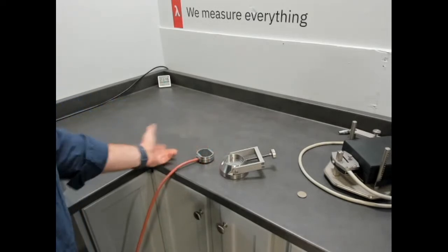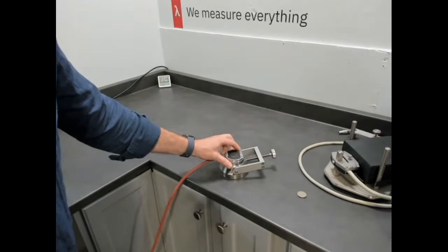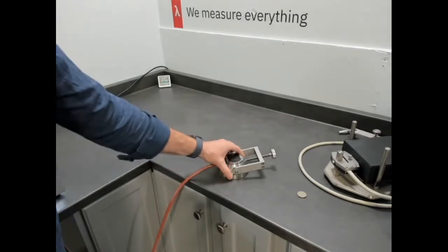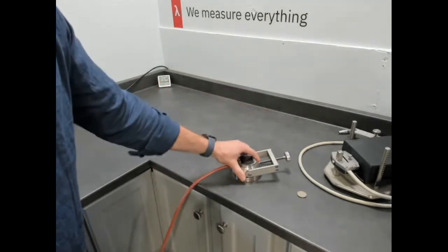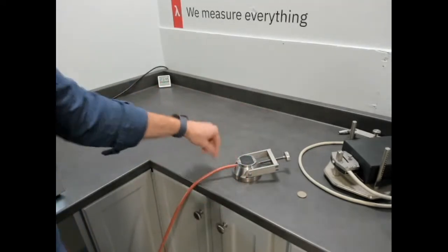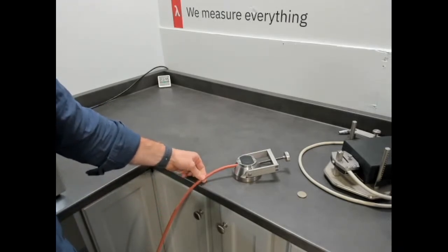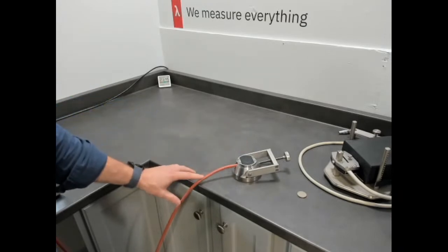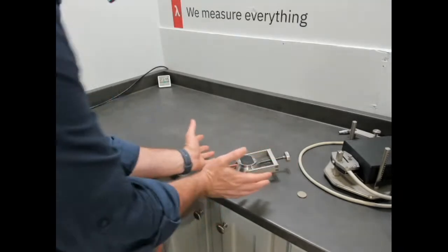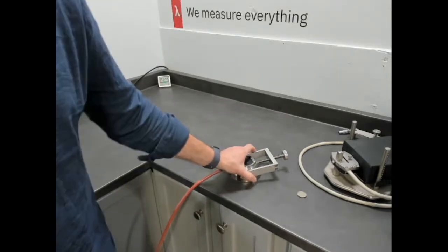You can of course make measurements on large materials by inverting the sensor, but this is just a seat for the sensor, and it has silicone on the bottom so that it doesn't move. That's nice if you put this in an oven. I think this MTPS sensor we have here is good up to 200 C. So this one as it is, I think, is minus 75 to 200 C, so you can put this in an oven and make measurements. We're just doing it on the bench for now.